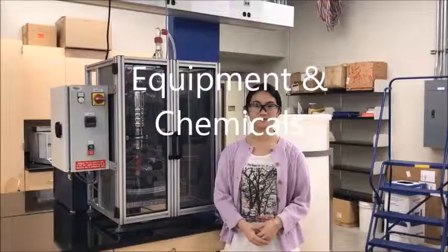I'm Steven. I'm Winifred, and this is the vapor-liquid equilibrium experiment. The objective of this lab is to determine the vapor-liquid equilibrium curve of 2-ethoxyethanol and water, and from this data to determine the binary activity coefficients. In this experiment, 2-ethoxyethanol and water will be used.